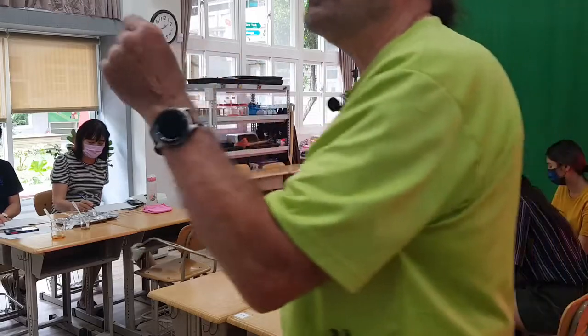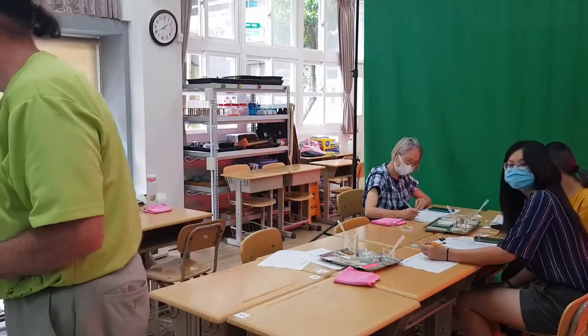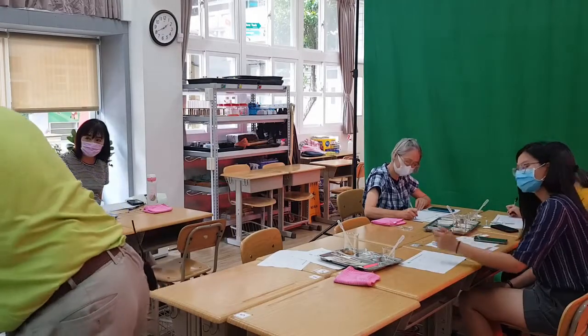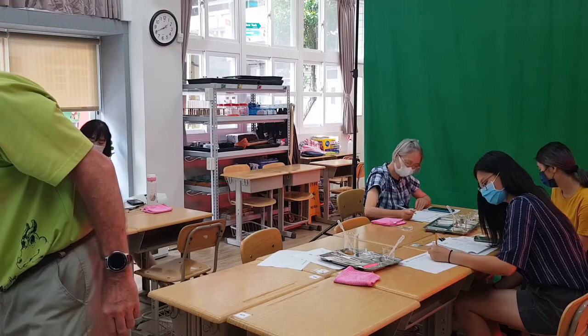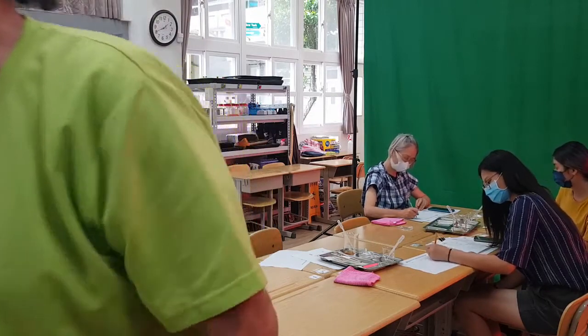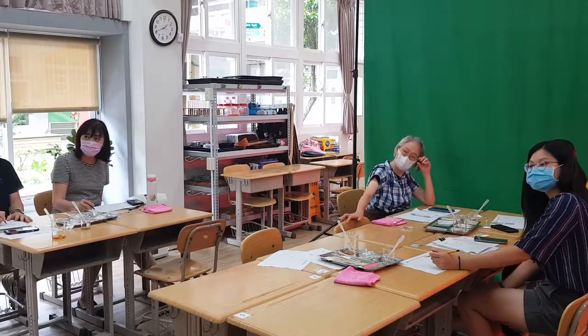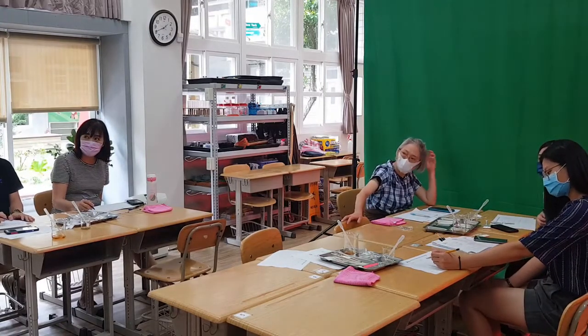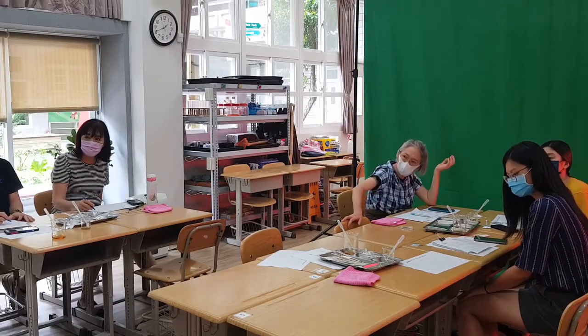So you can write down for A: heat, black, brown, bubbles. And the others, really nothing, nothing, nothing. So I don't want to use the fire too much, but I want to show that there is a difference, and depending on the age of the students, we can use this stuff.